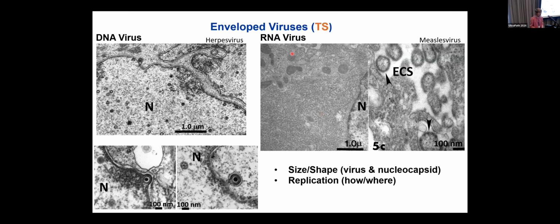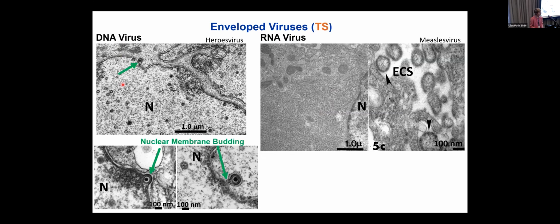So here are examples of envelope viruses. The previous ones were naked viruses. On the left, again, we have a DNA virus. Its nucleocapsid is going to be constructed in the nucleus. And it's going to get its envelope by budding through the nuclear membrane, seen here at the bottom. Here's one that's almost budded from the nuclear membrane into the cytoplasm. Here's a nucleocapsid in the nucleus, and here's a complete virion that's gotten itself almost into the cytoplasm.